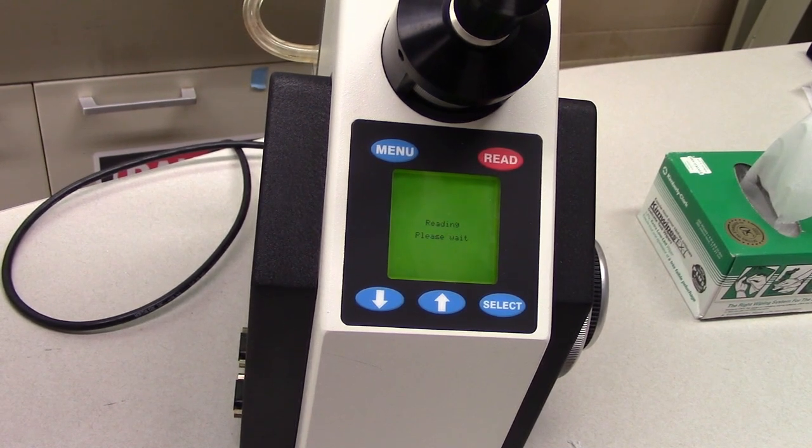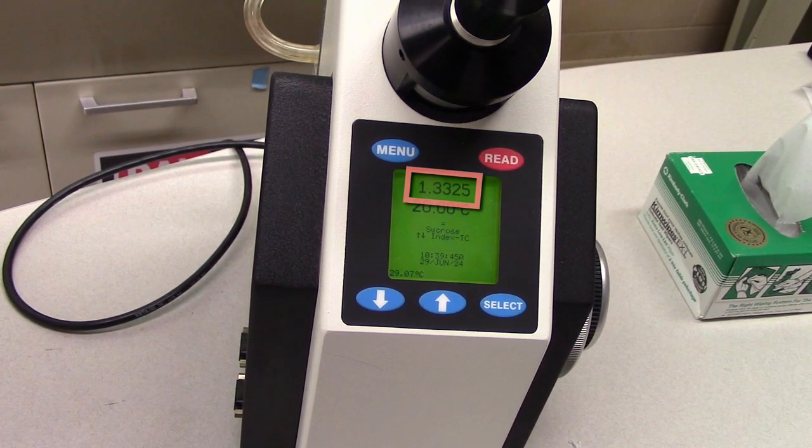Wait for the refractometer to take the reading, then record the refractive index for the sample.